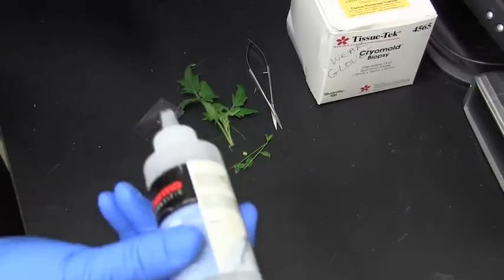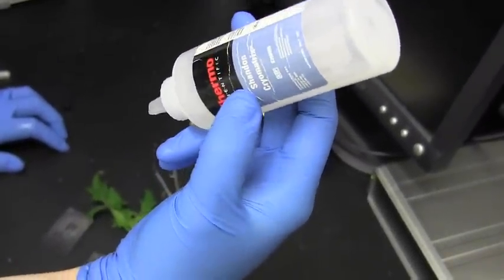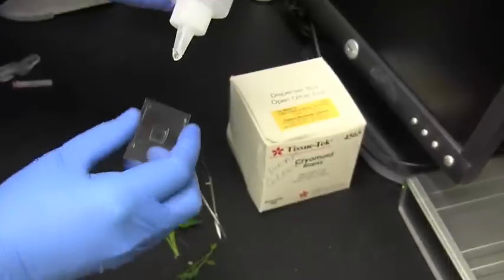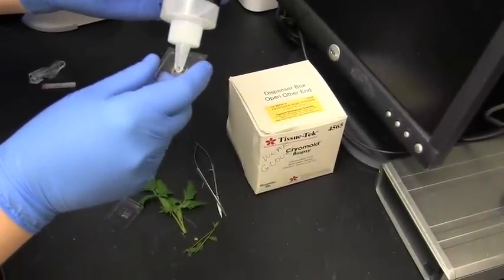This is the cryo matrix. You want to make sure that there's no air in the tip when it comes out. If there's air bubbles in the tip, you're going to have air bubbles in your sample block.